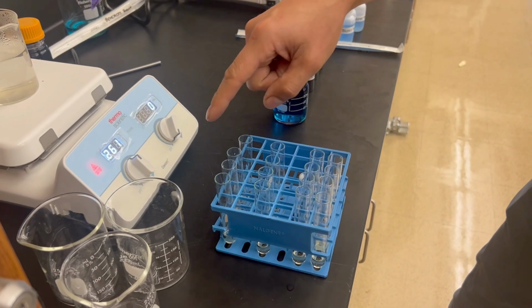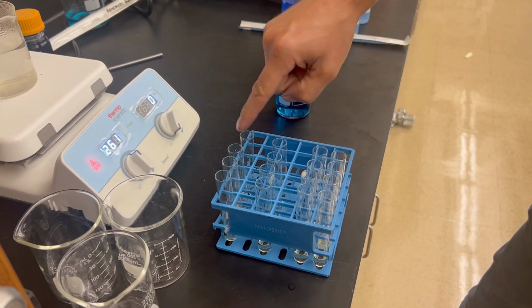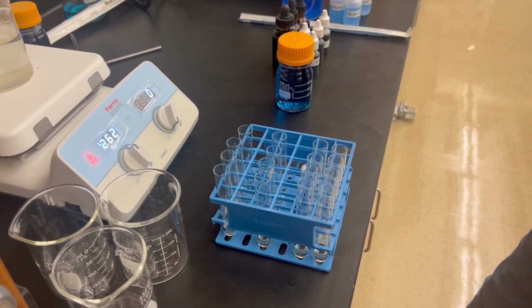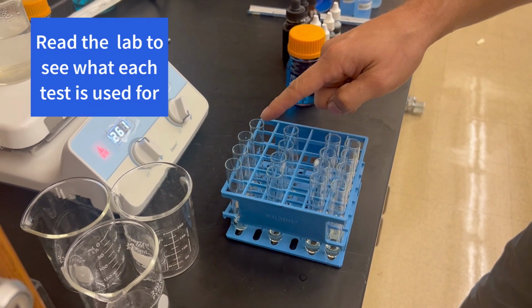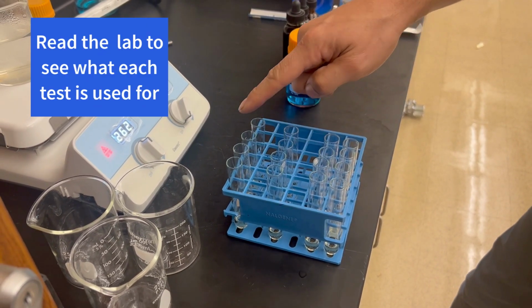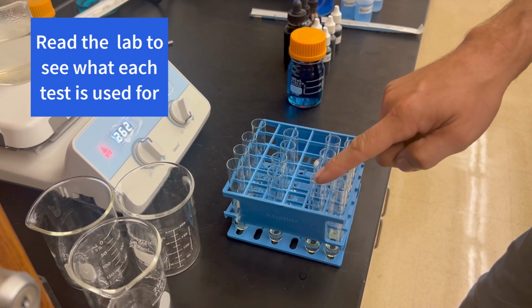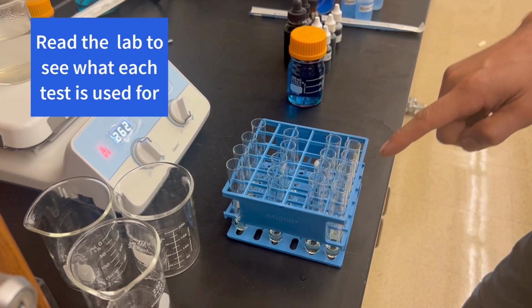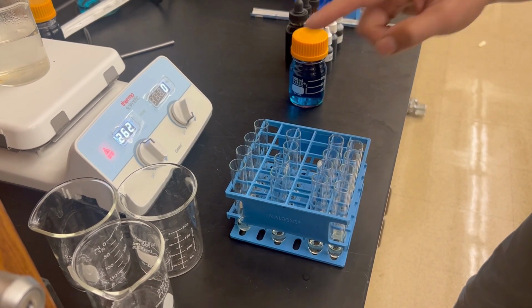All right. So in these tests, we have solution A, B, C, and D from the previous samples we just put in. We're going to be running tests on each one of these tubes. So this row right here is going to receive all Benedict's test. This row right here is going to do iodine test. This row right here is going to do Biuret's test. And this row right here is going to do Sudan test.